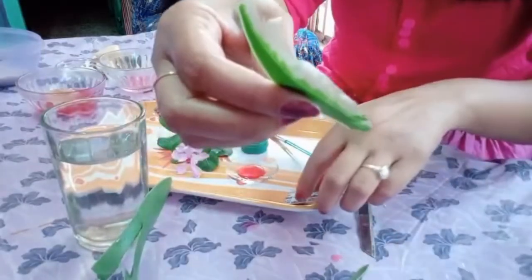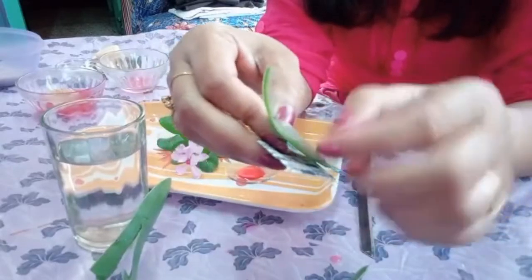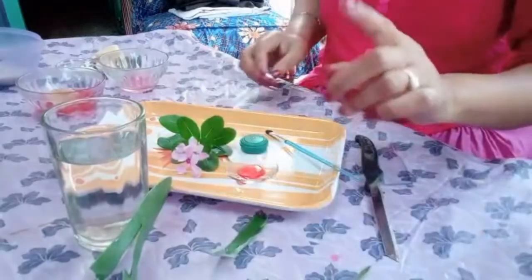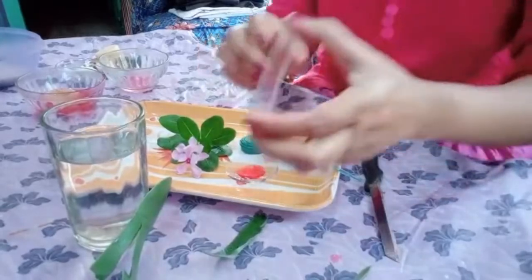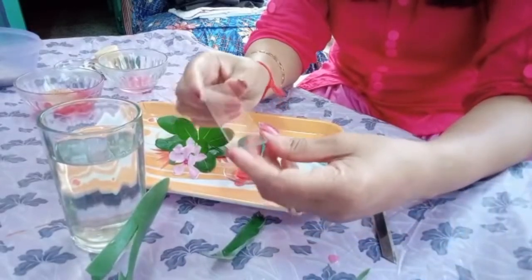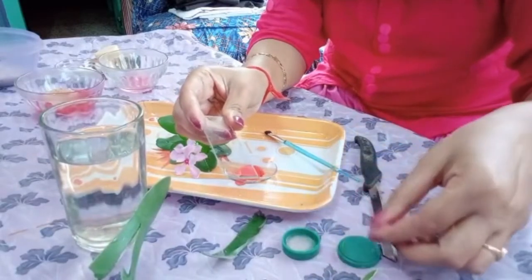Just cut a simple section. Always take a new blade at the time of an experiment. I have taken a new one. Just take this part. You can take it with a needle also. At this moment I do not have a needle, and I do not want to use my knife because it's going to spoil this layer. And before taking it, make sure that you have a glass slide, cavity slide if you are using for preparation of a mount. At this moment I am not preparing a mount. I have taken the slide, a clean slide. You can take a cover slip. I have done this to show you the technique. You can practice it at home.